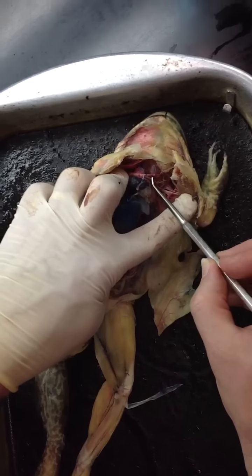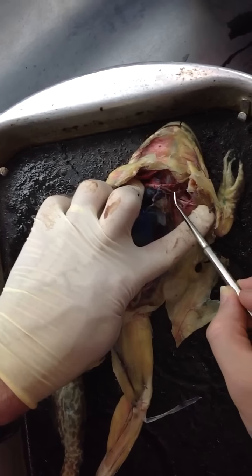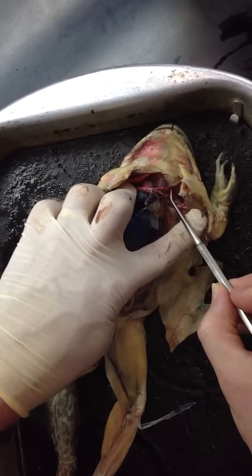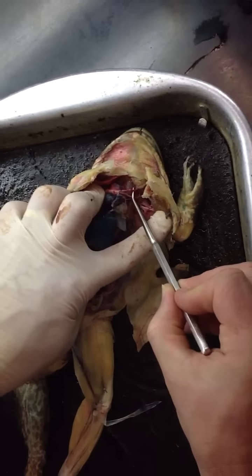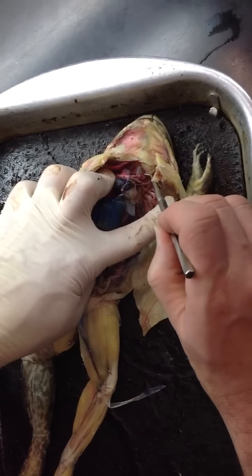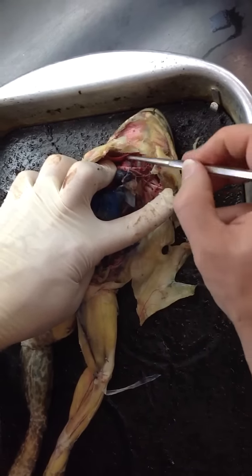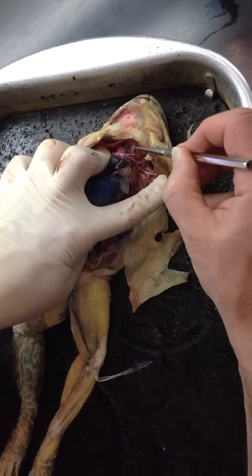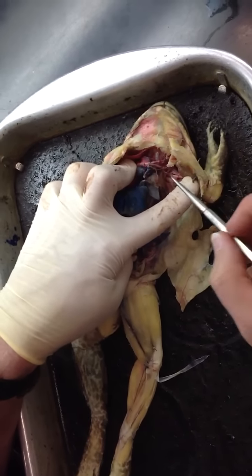That generally supplies oxygen-poor blood to, again, the skin, or the pulmonary artery to the lungs. Now back to the carotid arch, which is right here. It splits into two vessels, one of them going out to the side laterally and has this swollen carotid body or gland on it. That is the internal carotid artery. The external carotid artery is broken on this one, and it would be going up this way. So it's not present on this one. And there's often a thyroid gland there. It's not present on the specimen either.